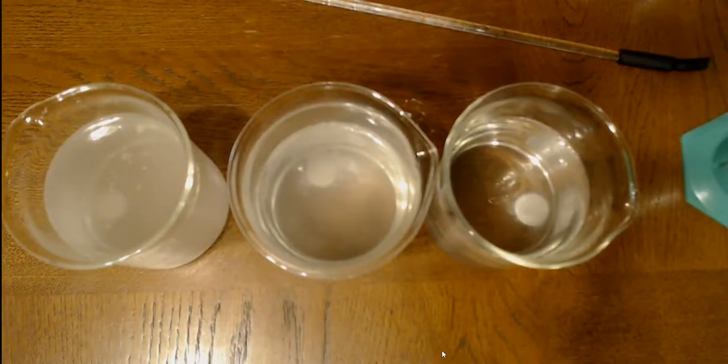So we see they're going to town here. This one's becoming very cloudy as it bubbles. This one clouding up a little bit. This one's still barely going. So we can see that difference in the concentration going there. I'm wondering if we let it go for a little bit, if we'll see differences in the size too. Let's give that just a little bit longer, and hoping we can still see this one as we go.